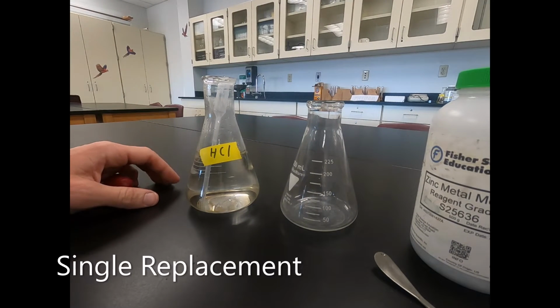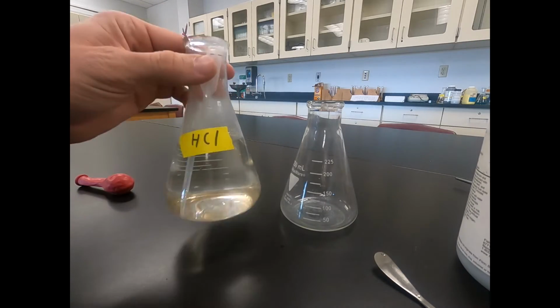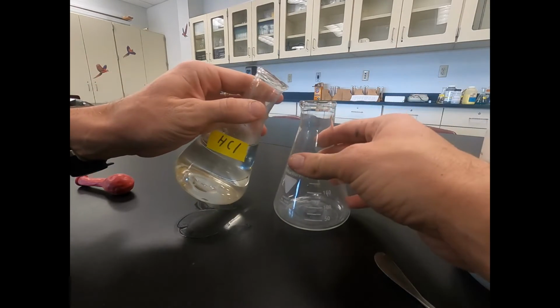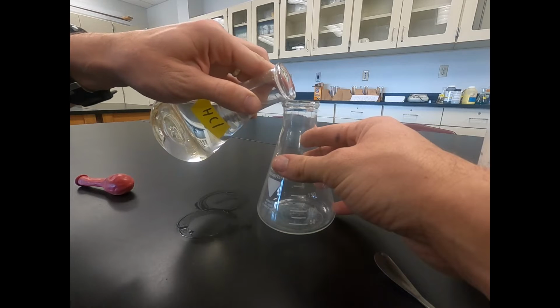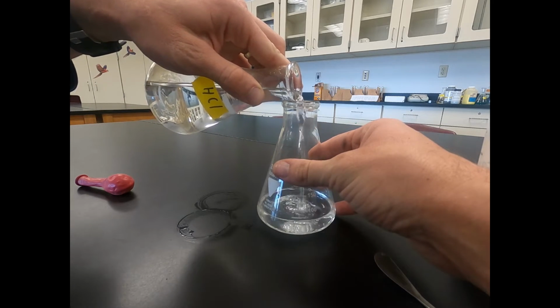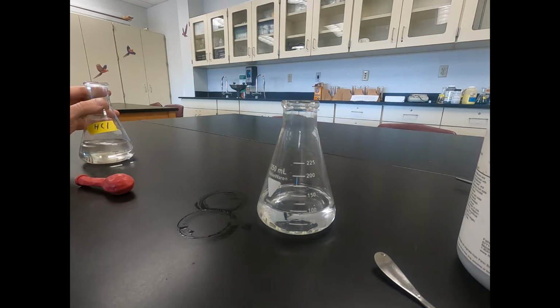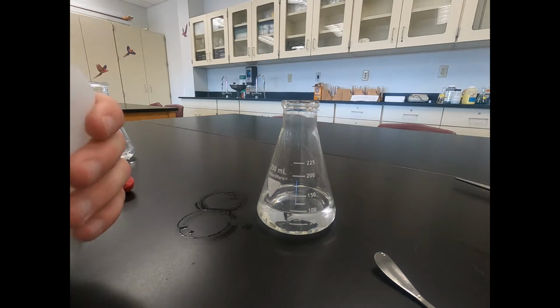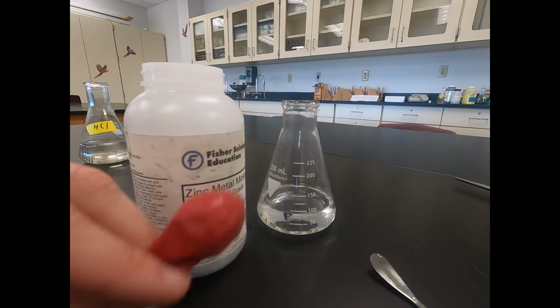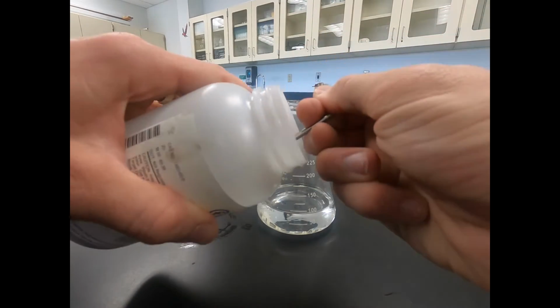So for our first reaction, we're going to do a single replacement reaction where we're going to use zinc metal and then hydrochloric acid. So we're going to take some of the hydrochloric acid and pour it from our stock into a separate flask. About 100 milliliters in. We're just doing approximate values today. And then we're going to add the zinc to it. Once we add the zinc, we're going to put a balloon over the top to capture the gas it creates, so we can help identify what gas is created in this reaction.